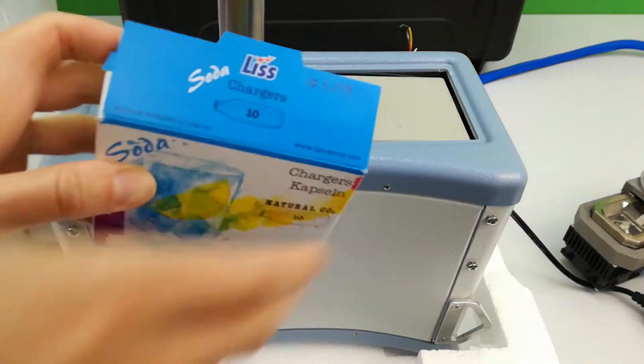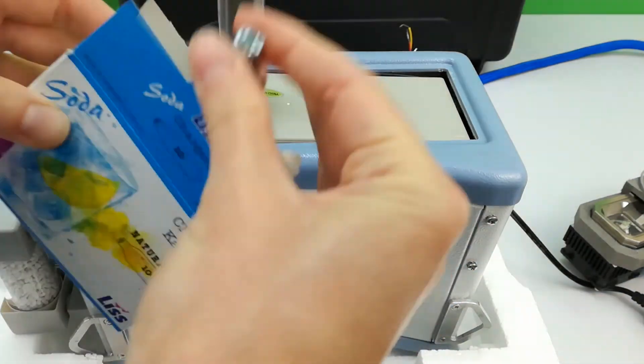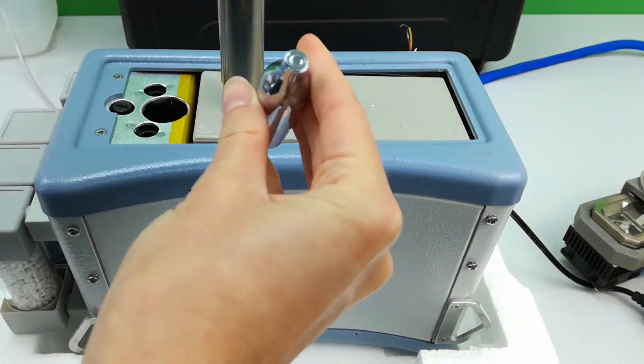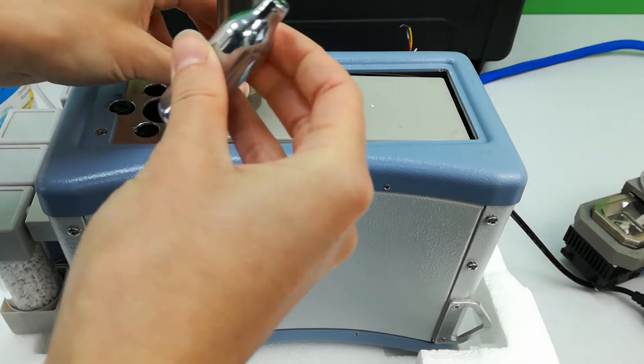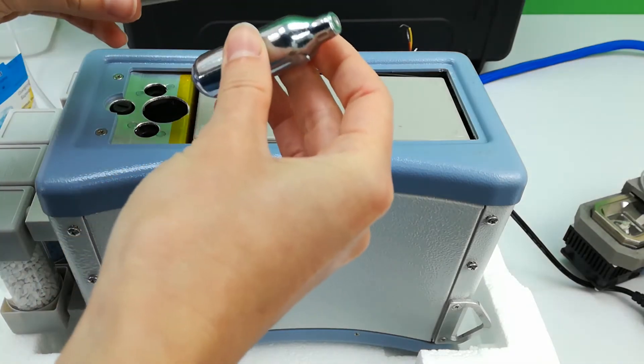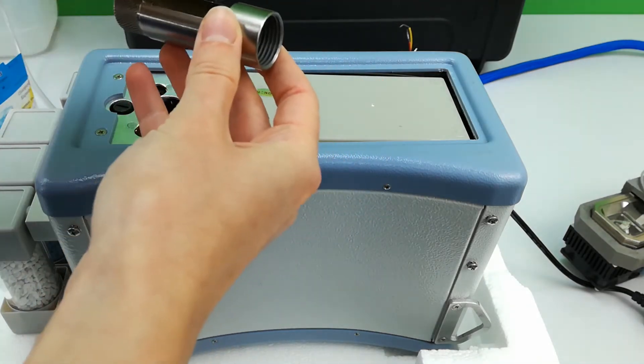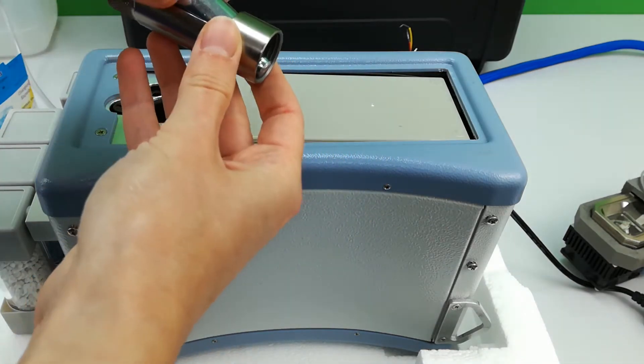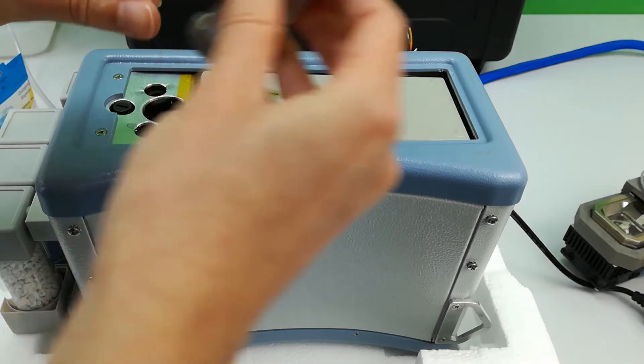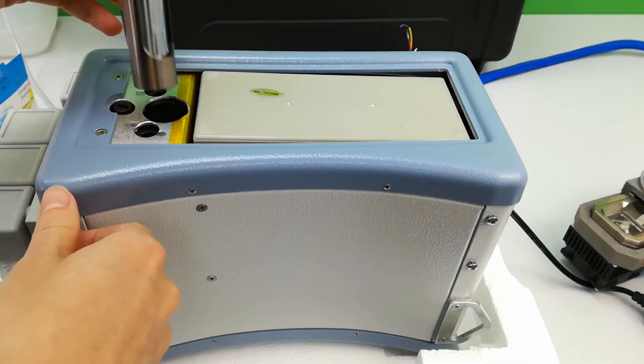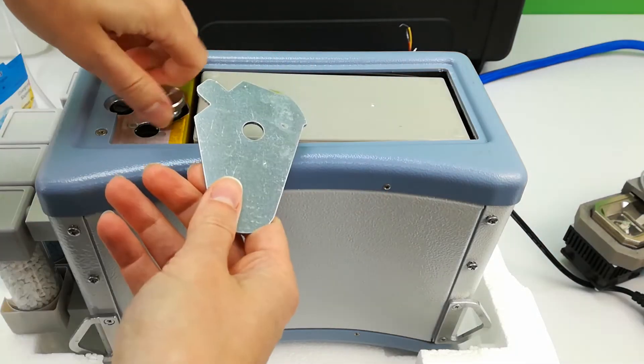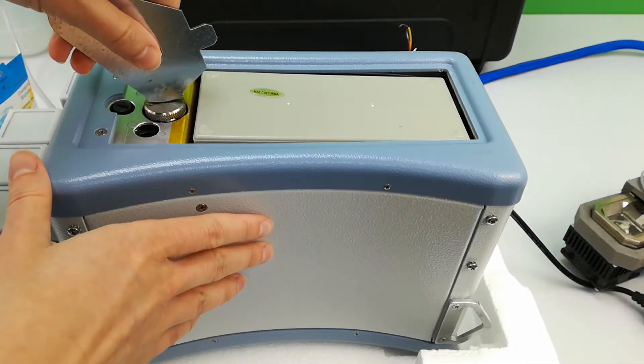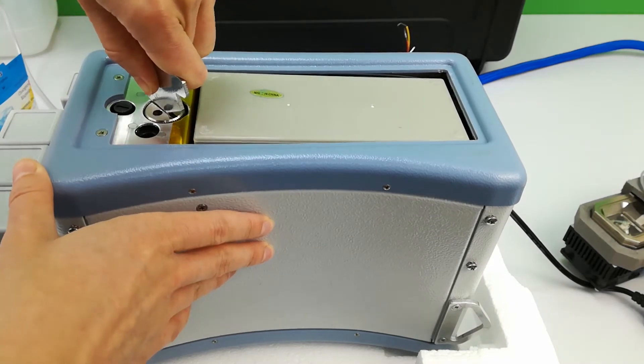You will find a set of 10 fresh cartridges in the spares kit. The cartridge is held by a magnet at one end of the holder. Install the holder, turning it clockwise and then using the tool to quickly tighten the holder until it is securely in place.